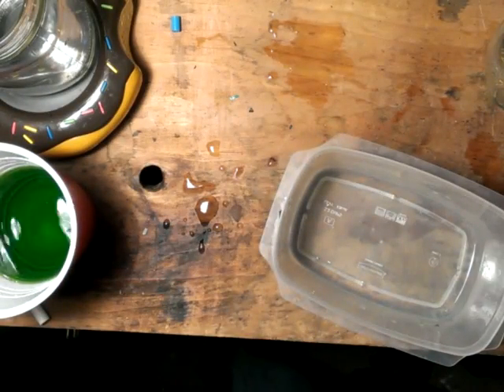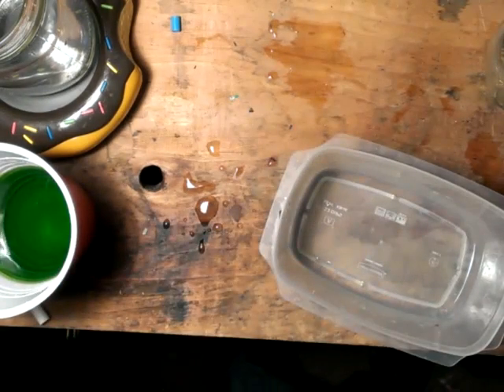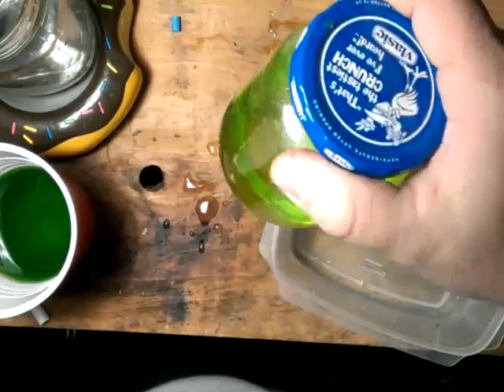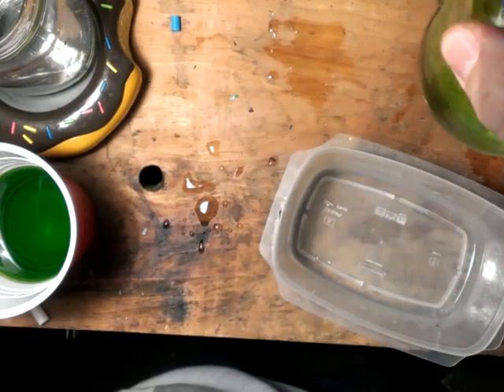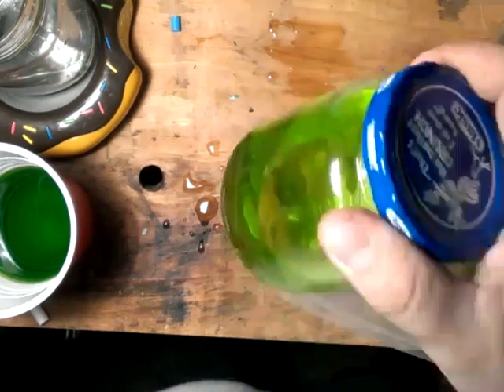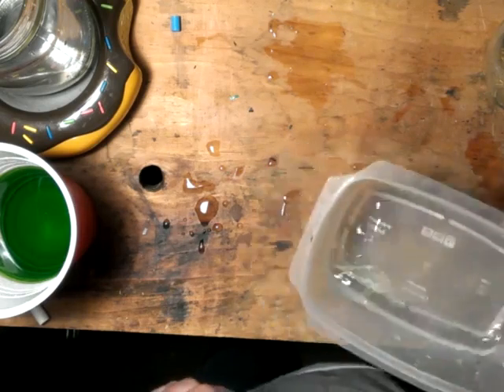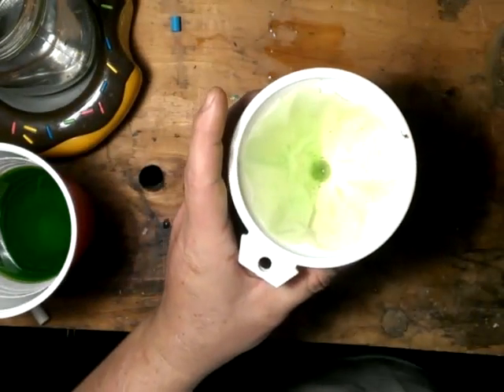Always save all your solution — whether it's leftover peroxide and muriatic acid, or leftover aqua regia, or muriatic acid and bleach. This has dissolved gold in it from previous videos. Save this — you can still get copper in there, there's also silver, possibly some palladium, platinum. So save all that good stuff. There are different methods for all of that.